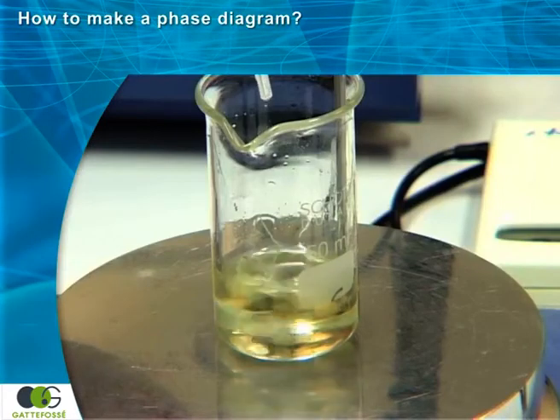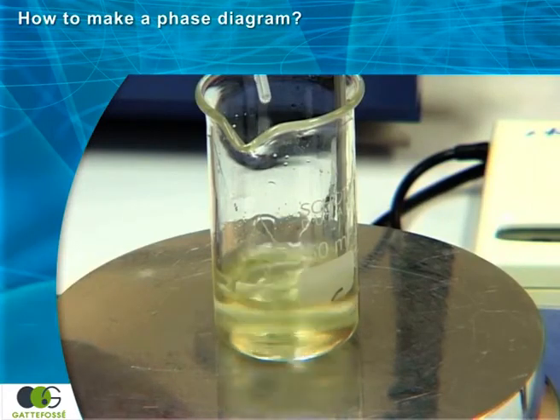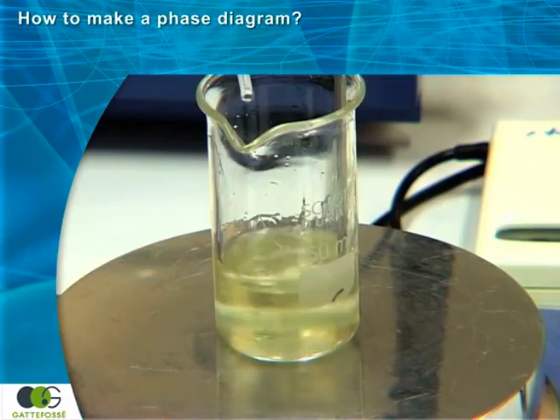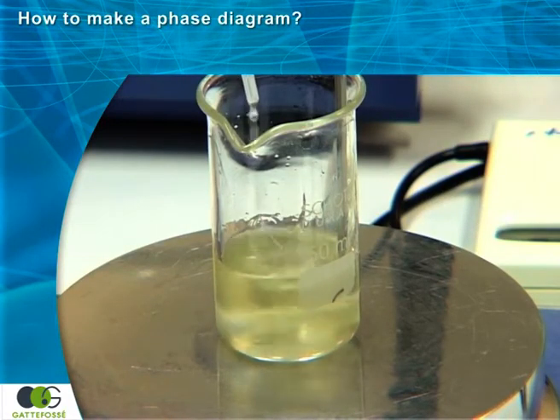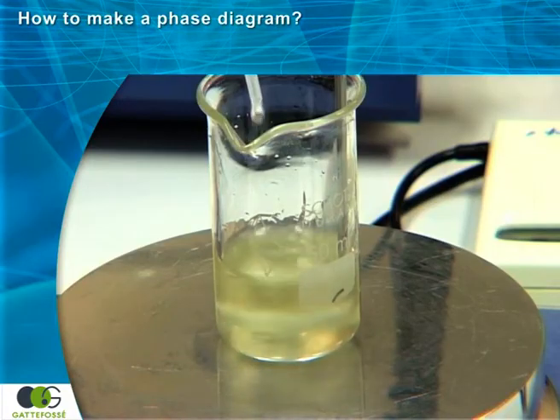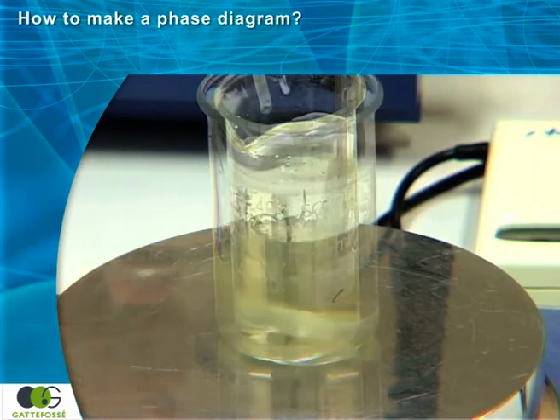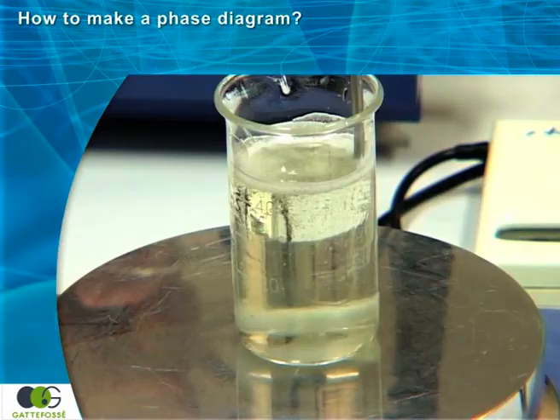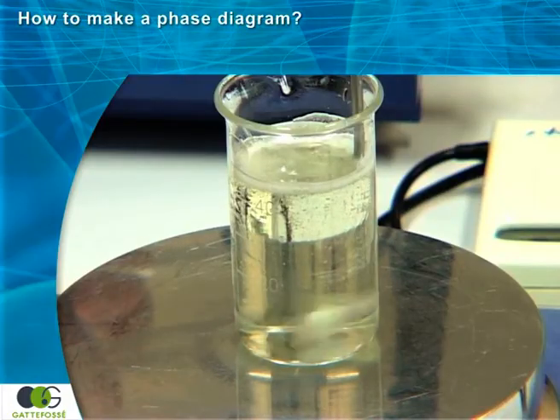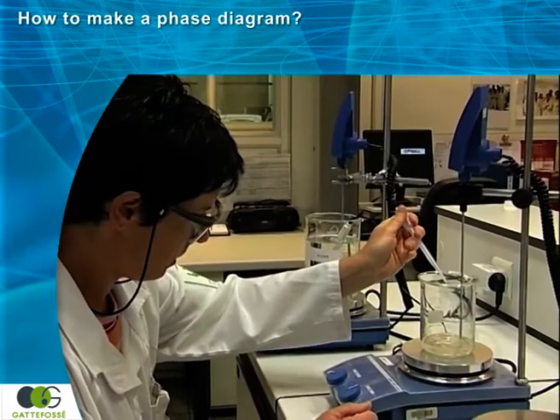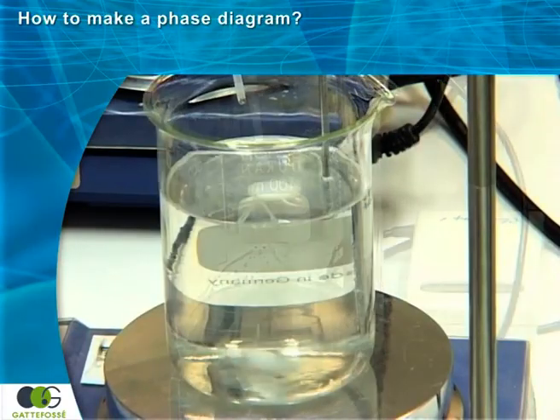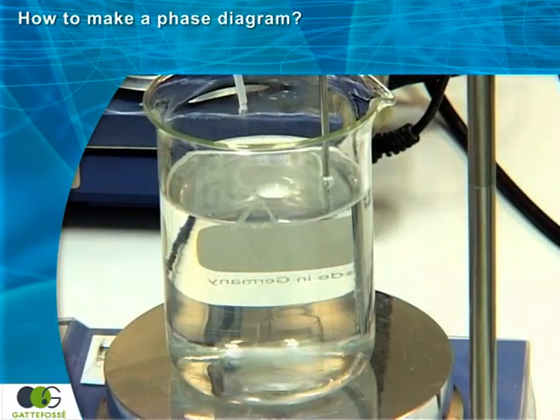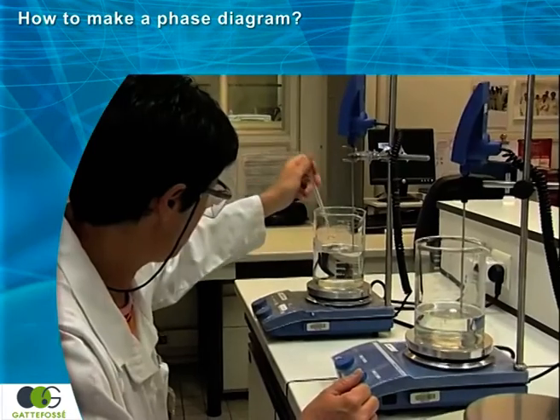Some formulas may only yield one type of phase which does not change during titration. These formulas begin as transparent and remain transparent during the dilution with water, meaning that the combination of oil and surfactant co-surfactant produces a micro-emulsion phase whatever the quantity of water. Again, the results of this titration are plotted onto the diagram.